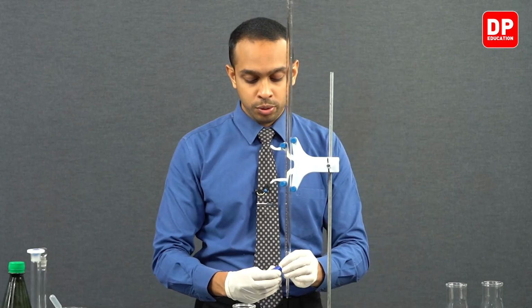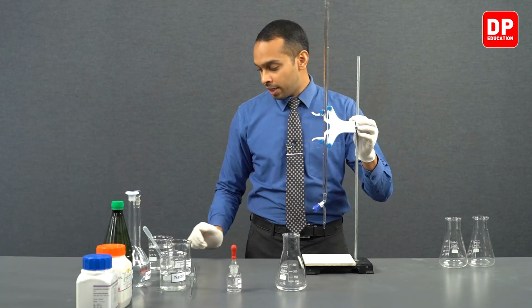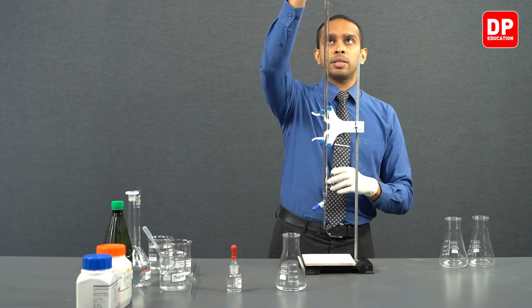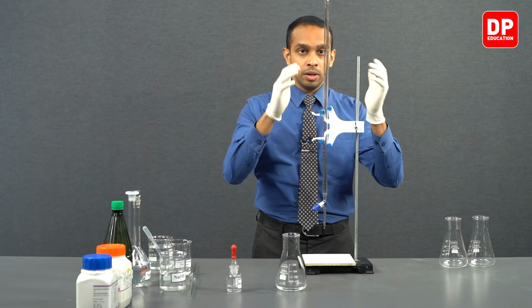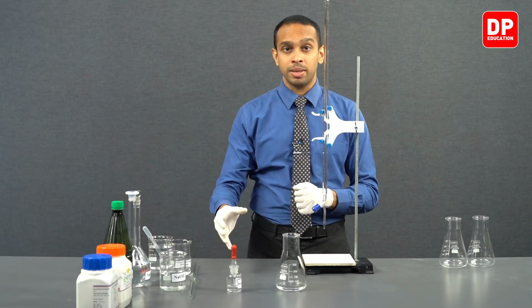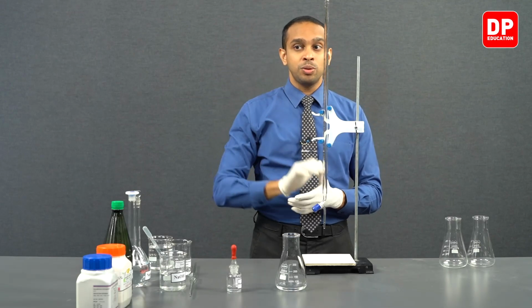Again, we are going to make sure that it is completely tightly closed, and then we can take a funnel, place it on our burette like so, and we'll have to bring this entire setup to our eye level first, because we are not supposed to take any chemical above our eye level or above our heads and start pouring into the funnel.